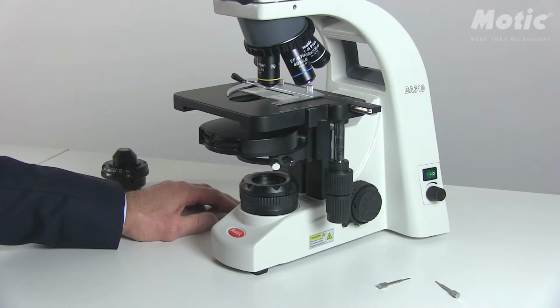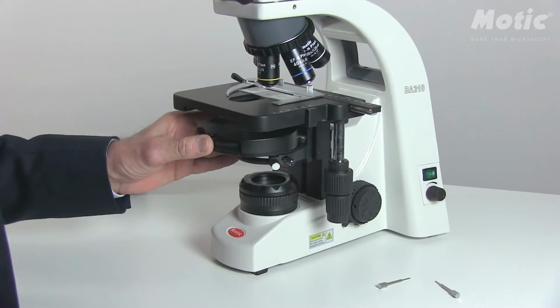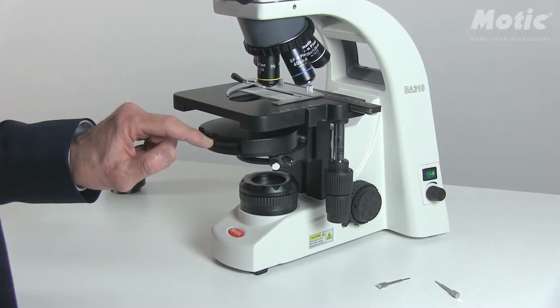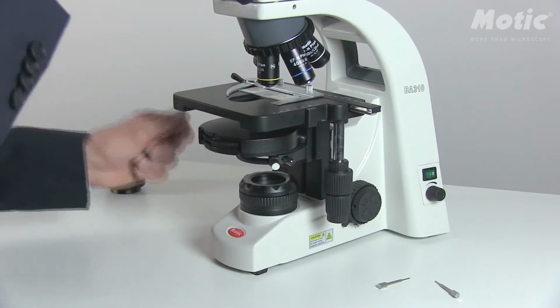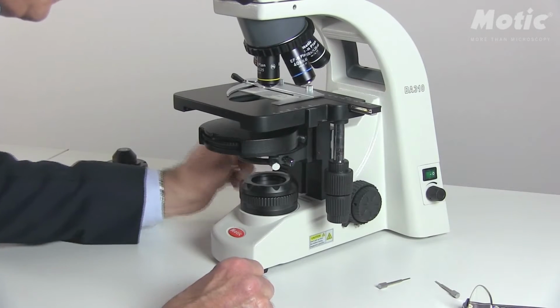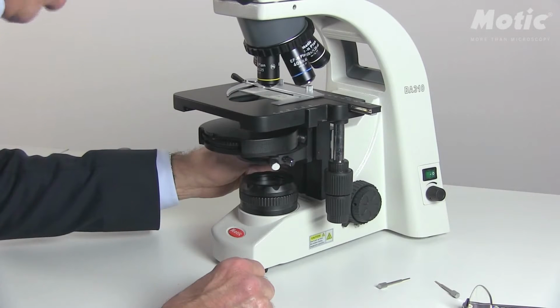Once the proper Köhler setup has been achieved, turn the condenser disc clockwise to one position so that you can read dark field at the front. Now the central stop is in the ray path in the back side of the condenser disc. Check your sample, and again change the condenser height up to the point where the background is homogeneously dark.